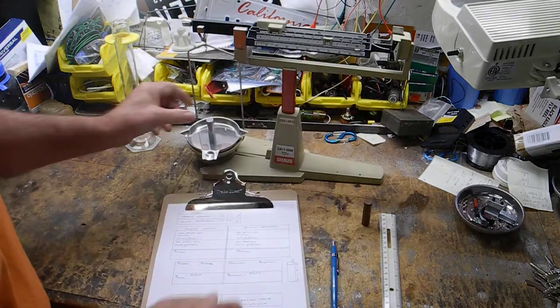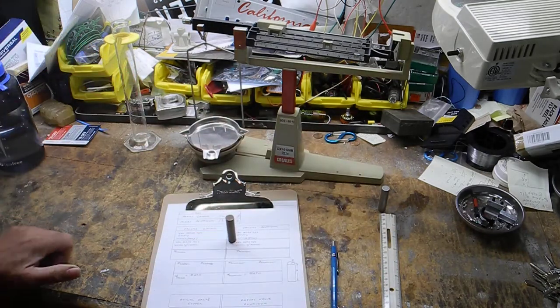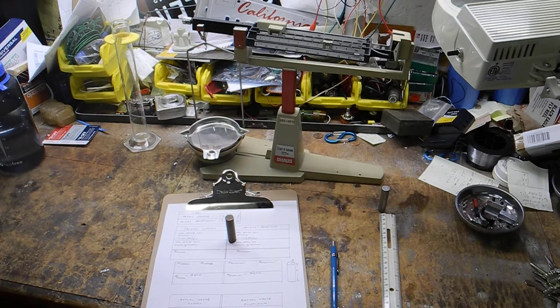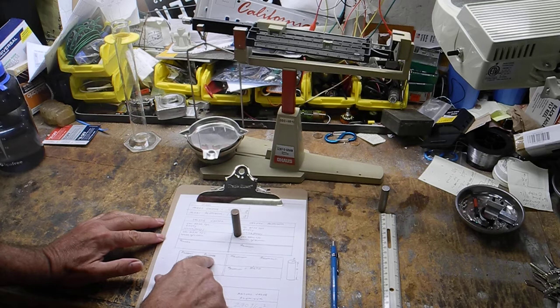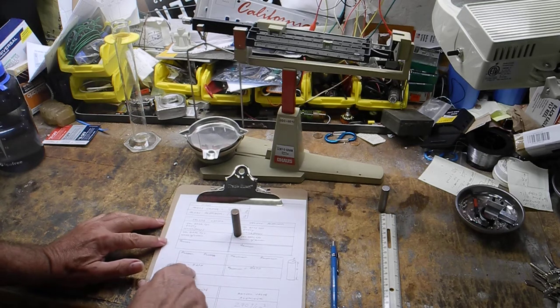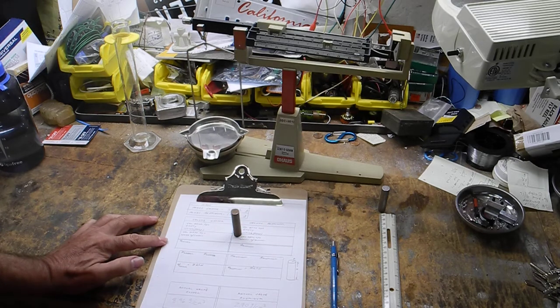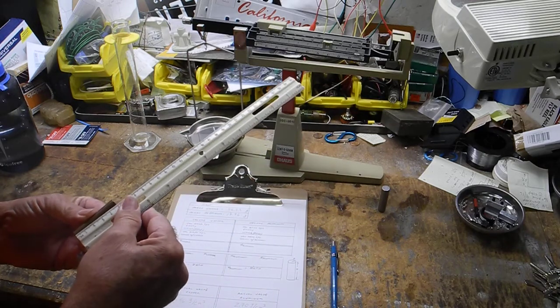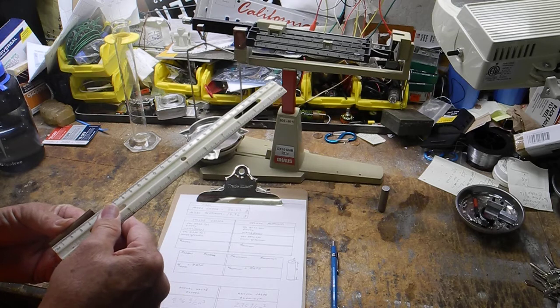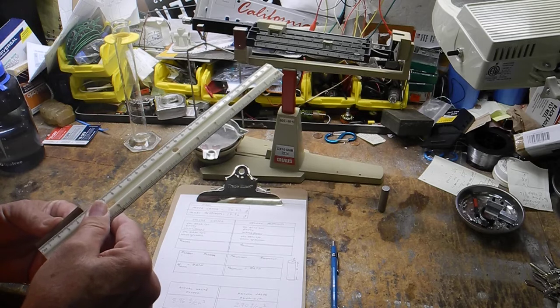I'm going to continue to do it in that sequence: copper first, aluminum second. Now we're going to do anything with water last, because we don't want to get it wet till the end. So here we're going to measure the height of the copper and the radius of the copper. And there's a spot right there for you to show your work and to calculate. So pi r squared h. Let's do the height first. I'm going to take my ruler in millimeters, put it there, and I've got 5.1.